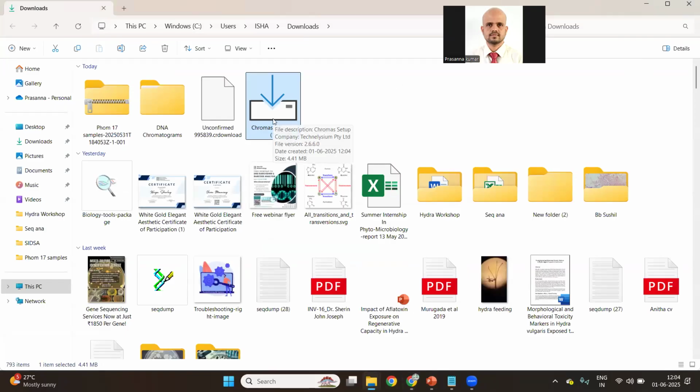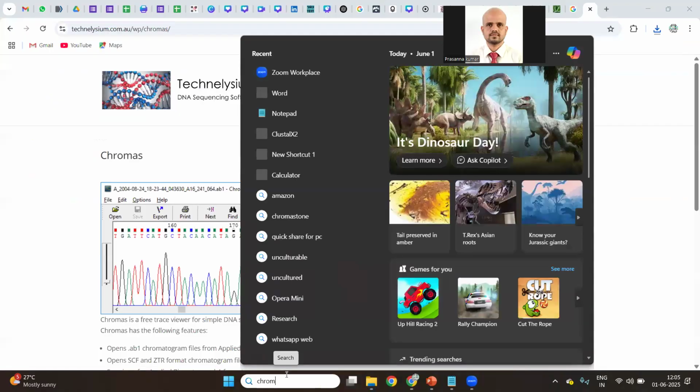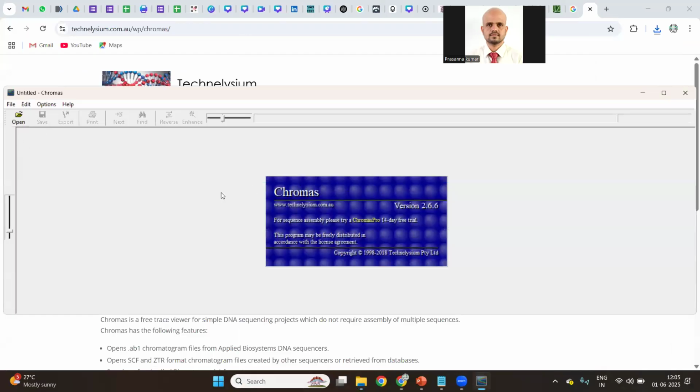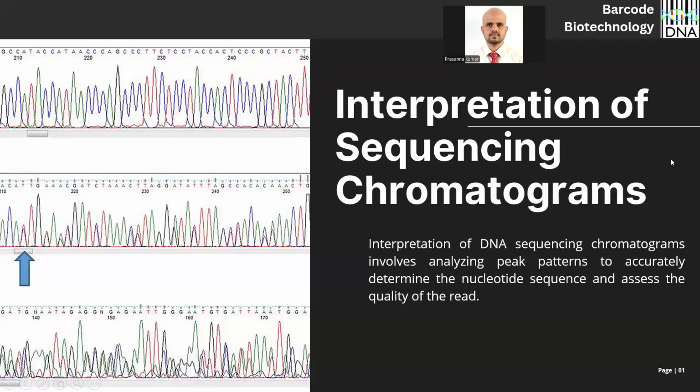You guys know what to do with the setup file, right? Double click it, accept the terms, and finish the installation. Since I have already installed it, I'm not installing it again. Once you have finished the installation, you will see something like this, an icon where you can open it. So this is how Chromas Lite looks. Today I will be emailing you three chromatogram files. You can use Chromas after installation and open those files. I will tell you the assignment at the end of this presentation. So that's how Chromas is installed and the chromatogram files can be read through this software.